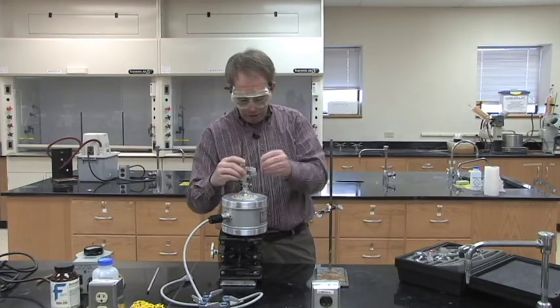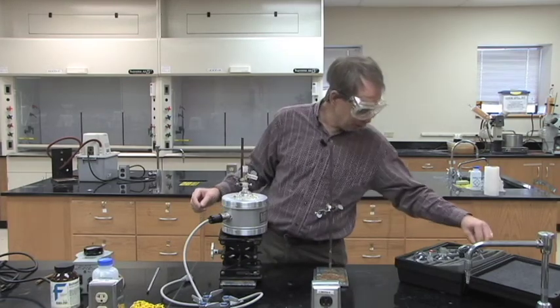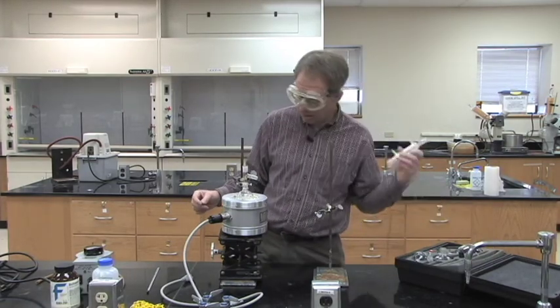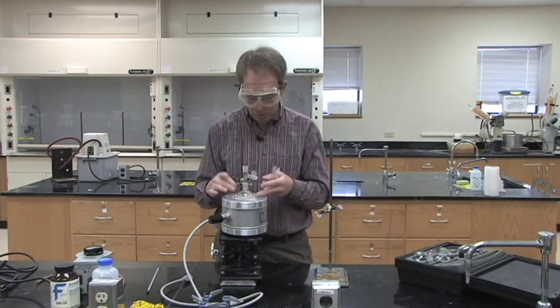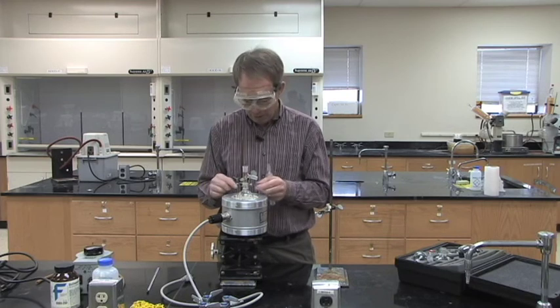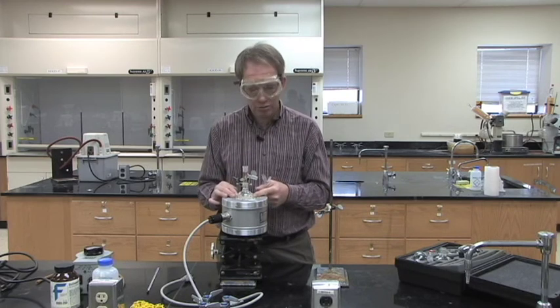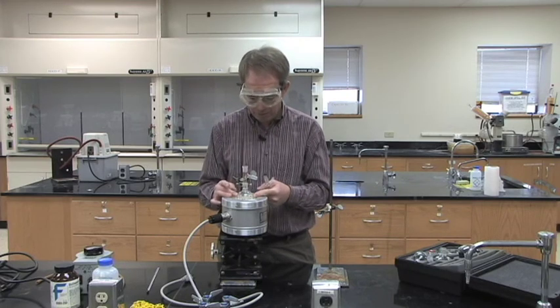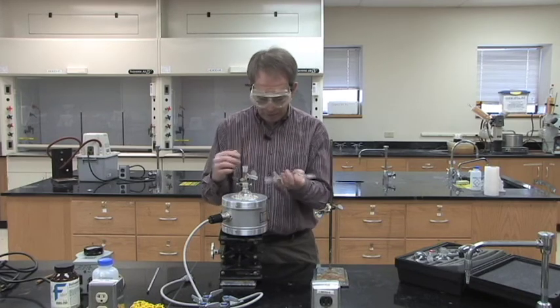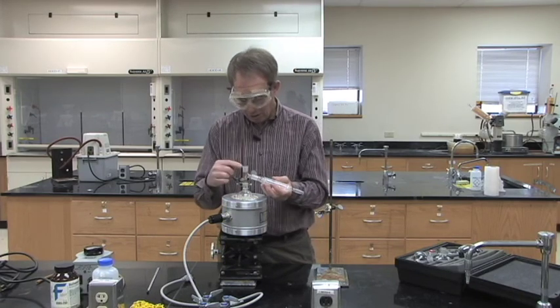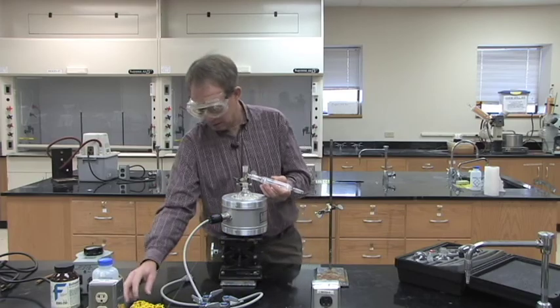And then, on top of this, we will have the adapter to go down to our condenser. Now, as we build this, we want to make sure we have a firm foundation for all our glassware. The round bottom we start with will be clamped to the ring stand and gravity will hold the distillation adapter in there.